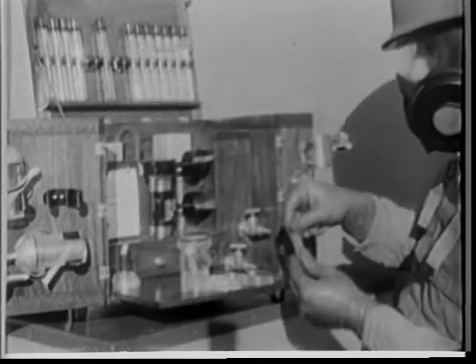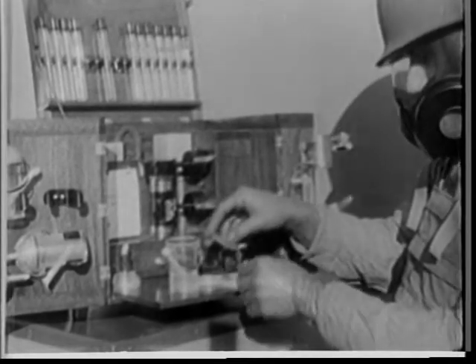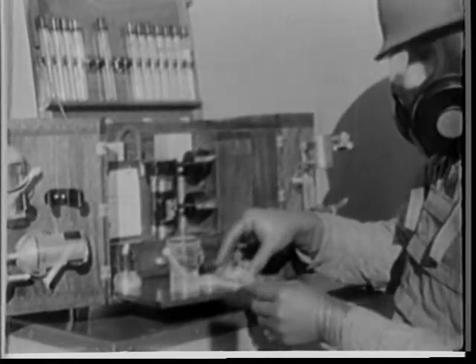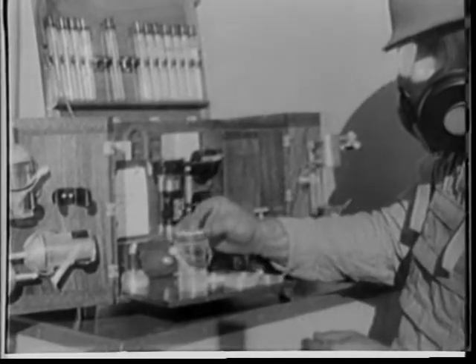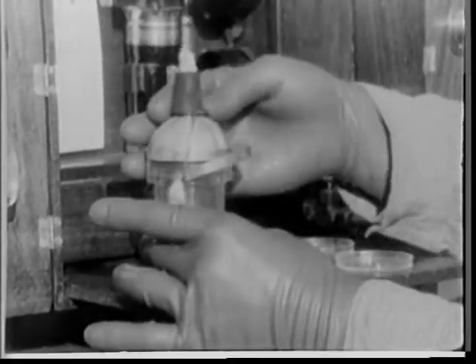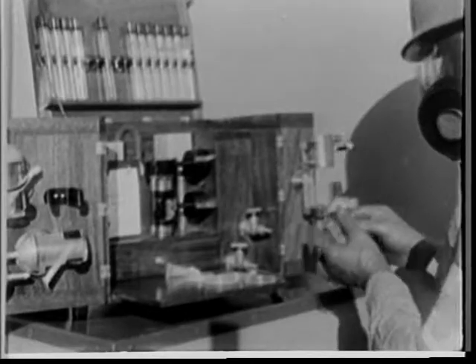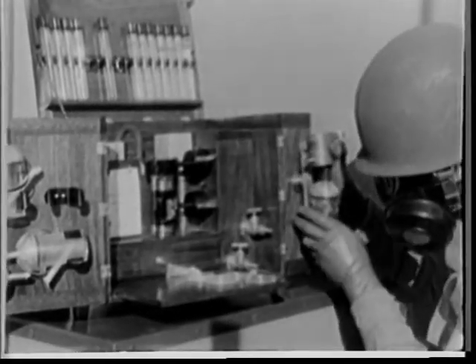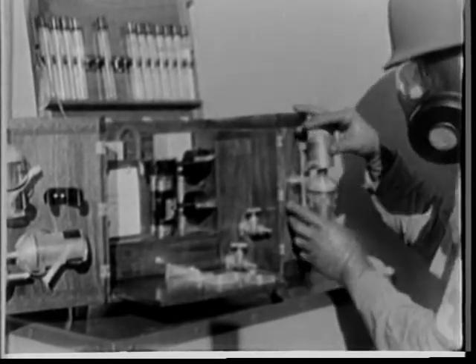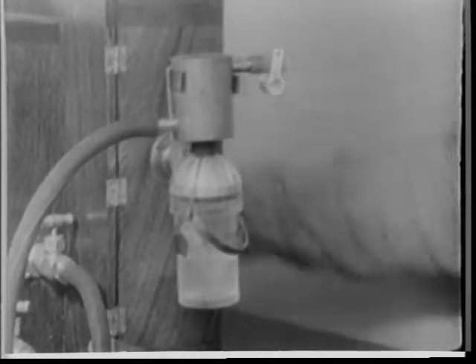This tube contains nutrients — food for the bacteria to grow on. He fits one of the filters on the impinger and puts the impinger cover in place. He removes the cotton plug, then connects the impinger to the pump. The pump draws air through the impinger and BW agents are trapped in the liquid.